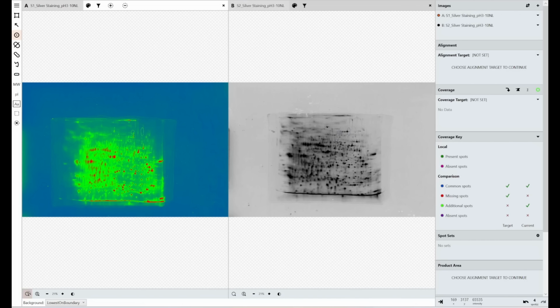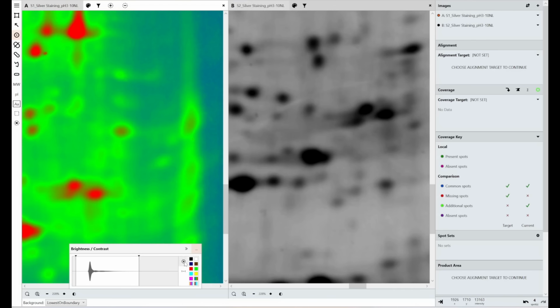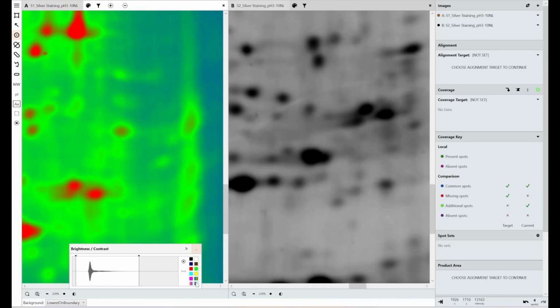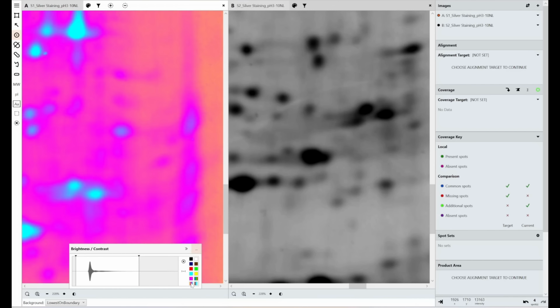So if I zoom in again with my heat map on, so you can see here we've got much greater clarity on faint spots, say here and here. But if I turn this off, they're much fainter to the human eye. So it's all to do with contrast and how the human eye processes light and processes kind of contrast on edges of spots.